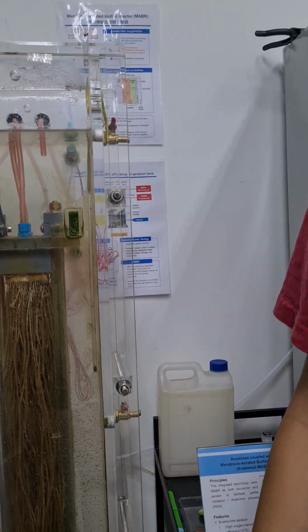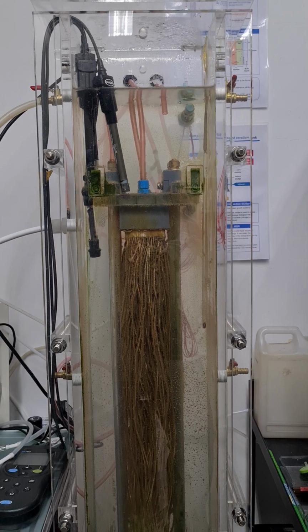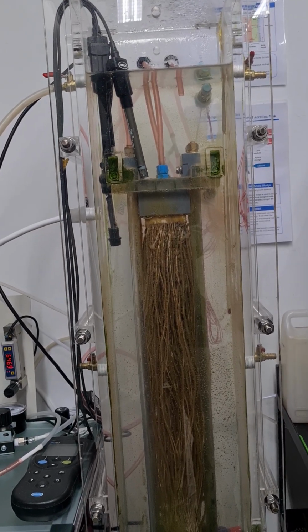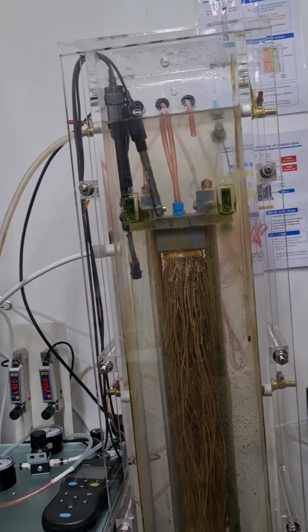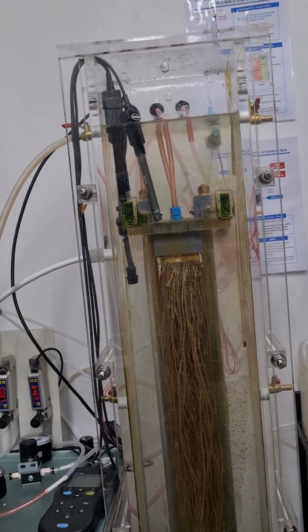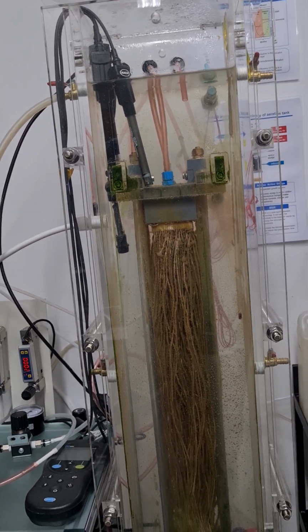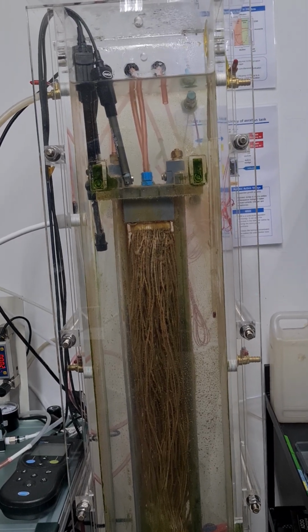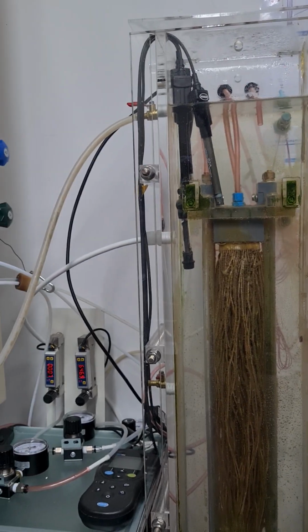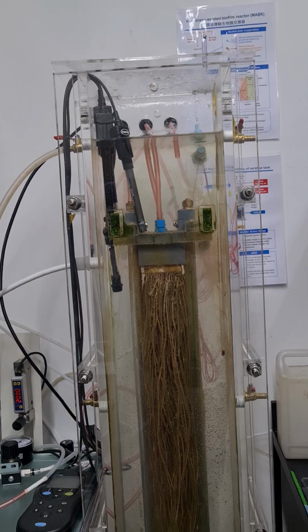That would be a good way, but in our pilot study, we found that some membranes in part of the reactor were stuck together and became black and not working. That's what we saw with our membrane. Oh, really? So maybe you will see that. But we do provide recirculation and also a little bit longer HRT. Okay. Fantastic. Thank you.